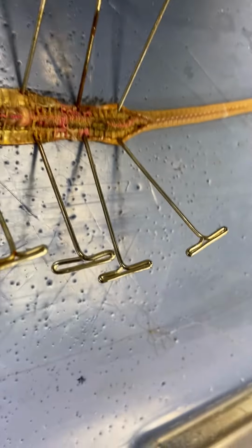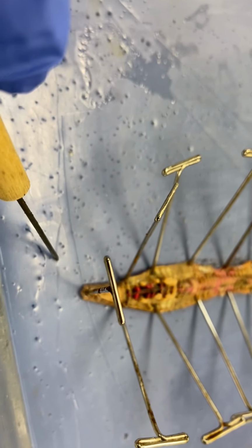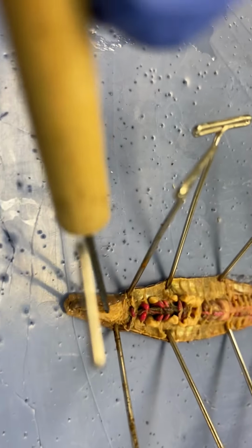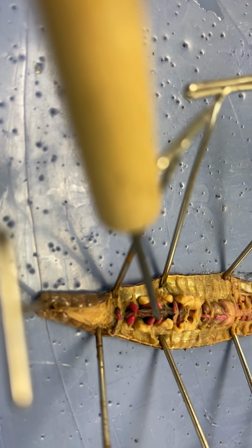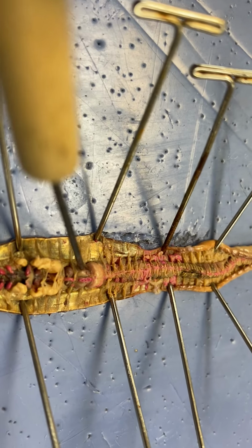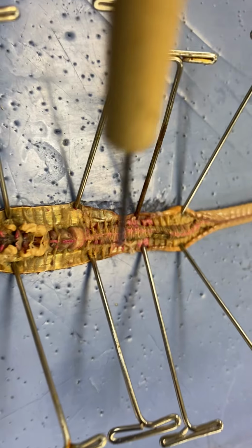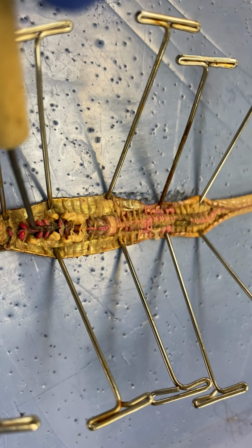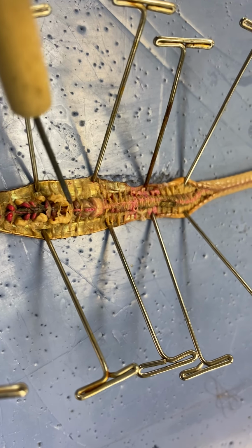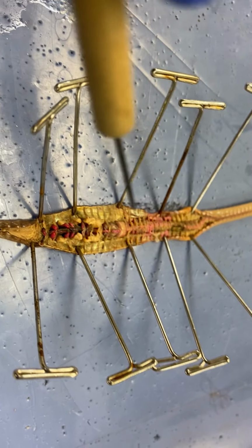Let's go over it again. It's kind of hard to hold. So you have the mouth with a lip-like structure, the prostomium. Then you have the pharynx. Then underneath you have the esophagus. The first pouch, the softer one, is the crop, then the gizzard, then the intestine. Then you have five pairs of aortic arches, the little red things. That is its heart. And the red, pink line running along the top is the dorsal blood vessel, because we are looking at the dorsal side.